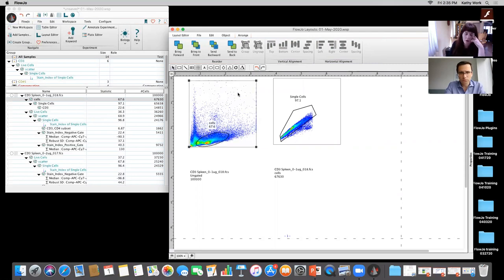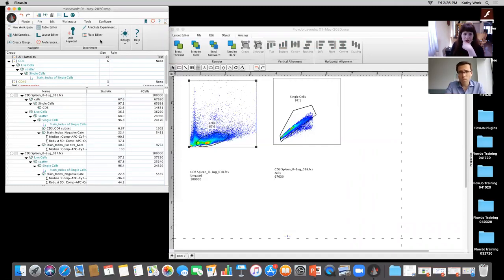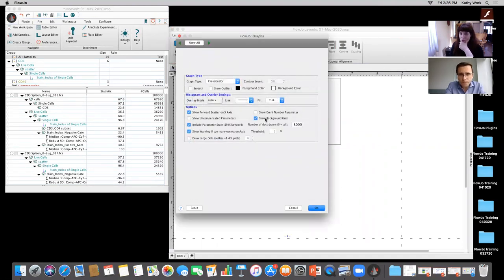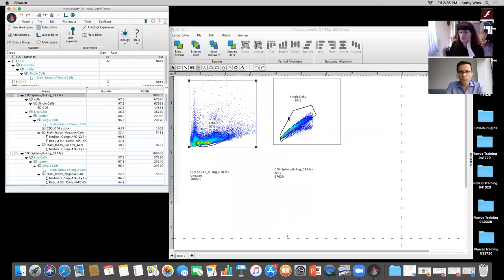I know you have the option of having grids in the plot itself if you go into preferences, if that's specifically what they're asking. That's right, they're saying put them in the grid aligned, yes. Okay, put them in the grid aligned. So I showed that, by going into preferences and graphs, you can show the background grid on the plot itself. I've never played around with that too much, to be perfectly honest. And we'd probably have to close out of FlowJo and open it up again to see.